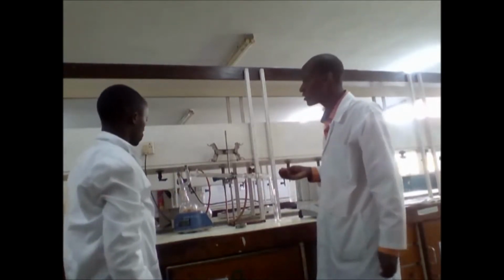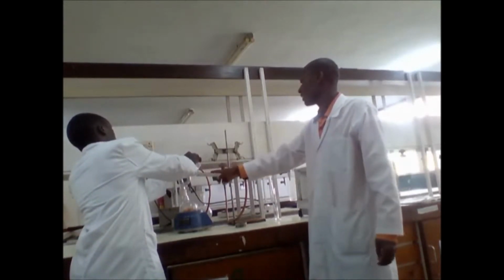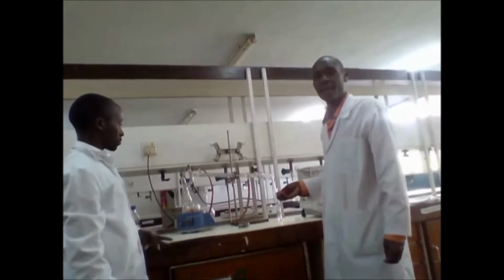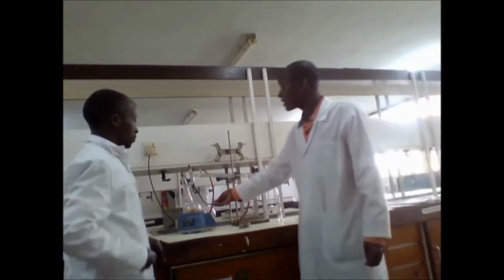And afterwards, you add some toluene through the top part of the condenser to collect the water to the receiving tube, to ensure that all the water is collected in the receiving tube. You continue for about 15 minutes, and if you find that the volume has increased by 0.1 ml, then you can repeat the process to ensure that all the water from the food sample is collected.